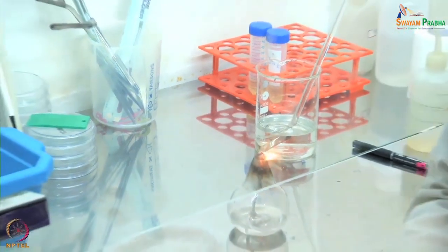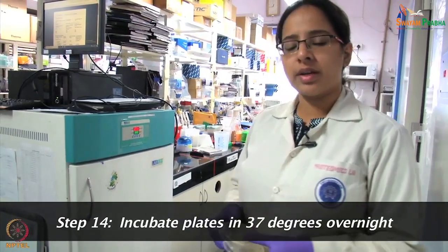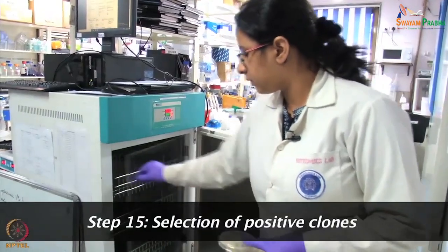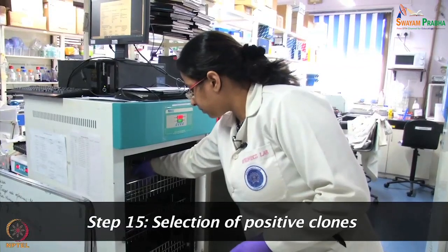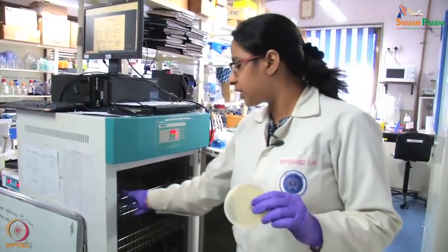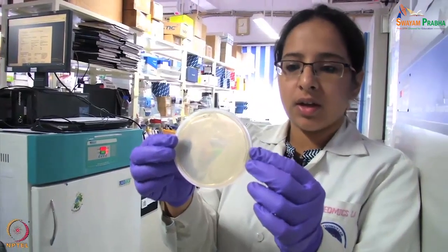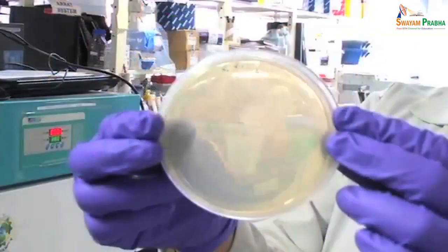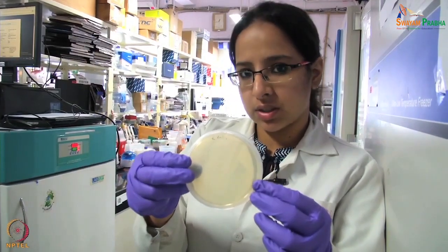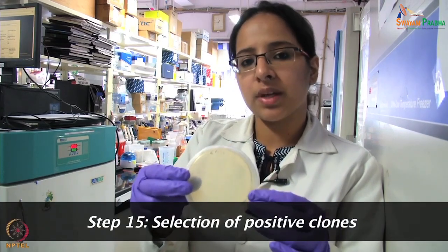I will take my plates and keep them in the incubator. These are the plates which I will keep for overnight incubation. As you can see, the temperature is set to 37–38°C, which is ideal for the bacteria to grow. I can show you another plate on which we already did transformation yesterday, to show how a transformed plate looks. This is a transformed plate which has a lot of colonies. The transformation efficiency has been very good. In some cases we do not get as many colonies. We have kept two plates — in one we hope for good transformation efficiency, and the second should be blank since it is just water, ensuring no contamination.